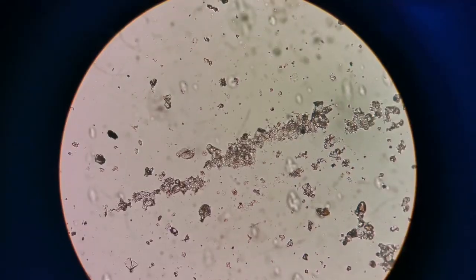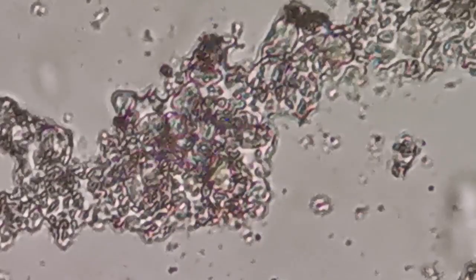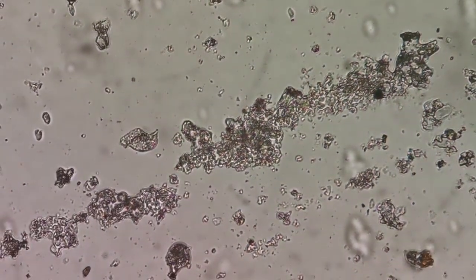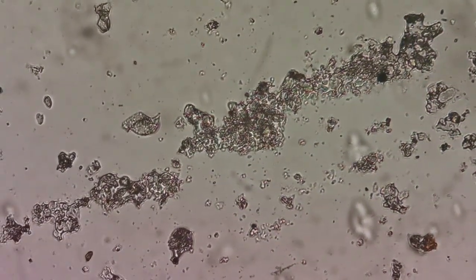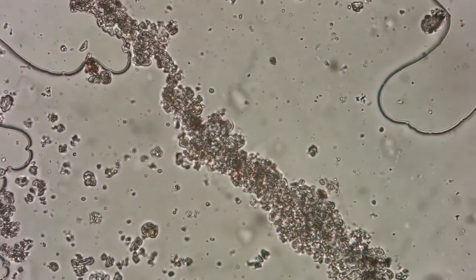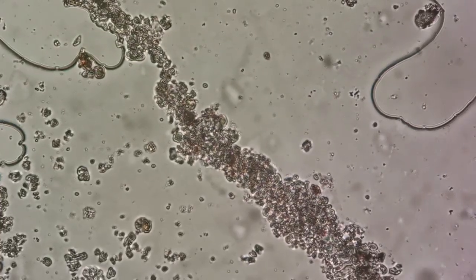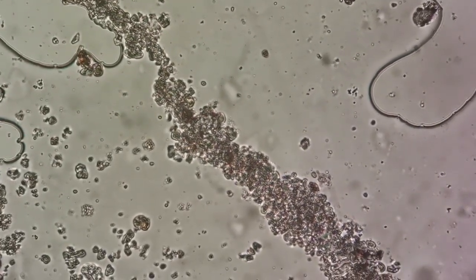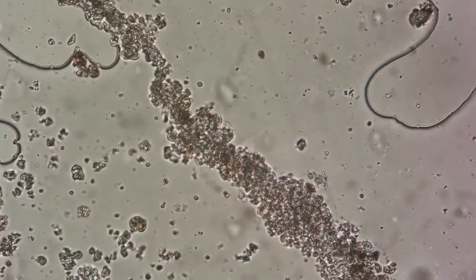dust. The various shapes. If I magnify this, you can see the fringe, showing the wavelength diffraction of the object. Again, you can see a kind of clumping of the dust on the edge of a raindrop, which has fallen on the car and then has dried up. And that's the shape of the material.